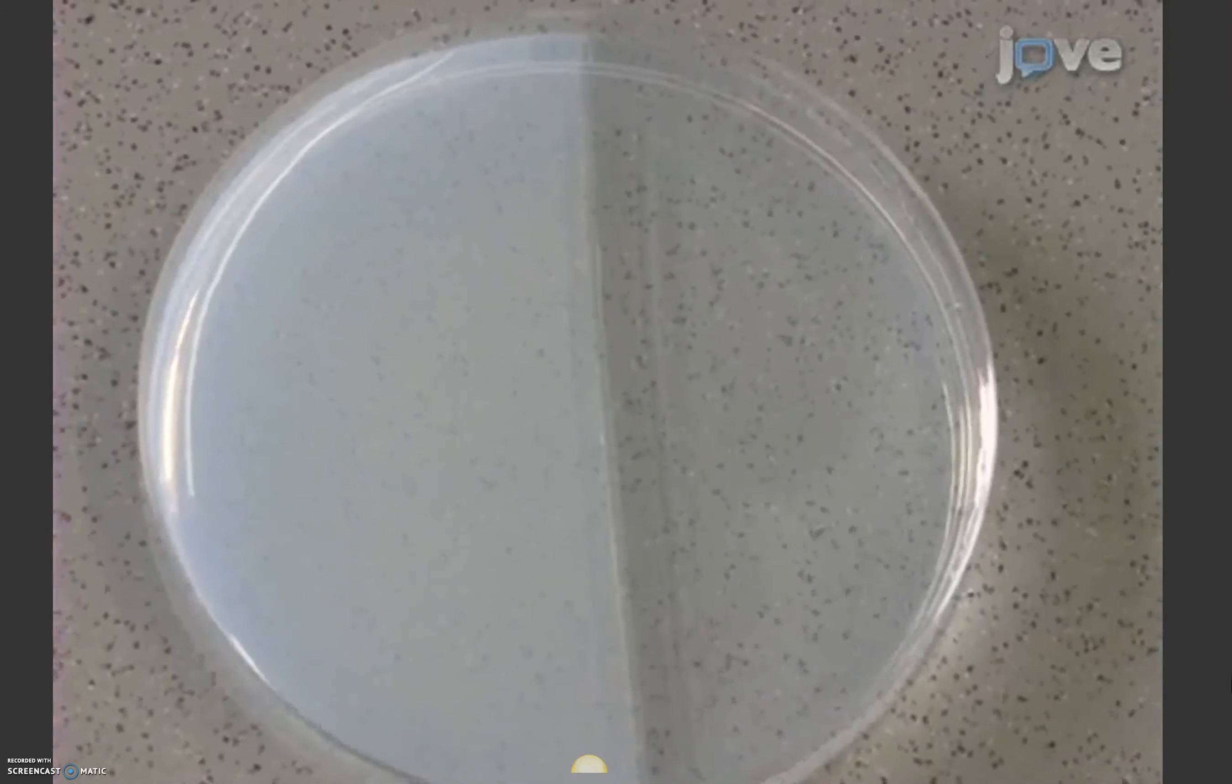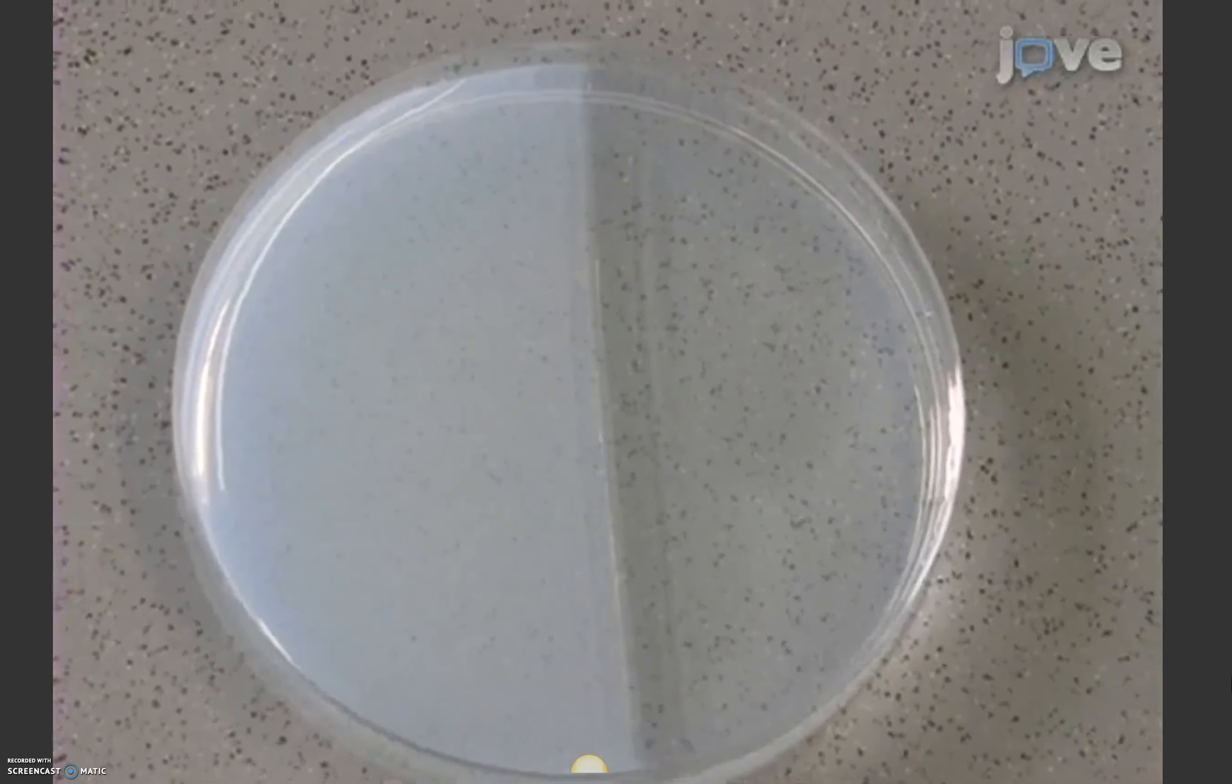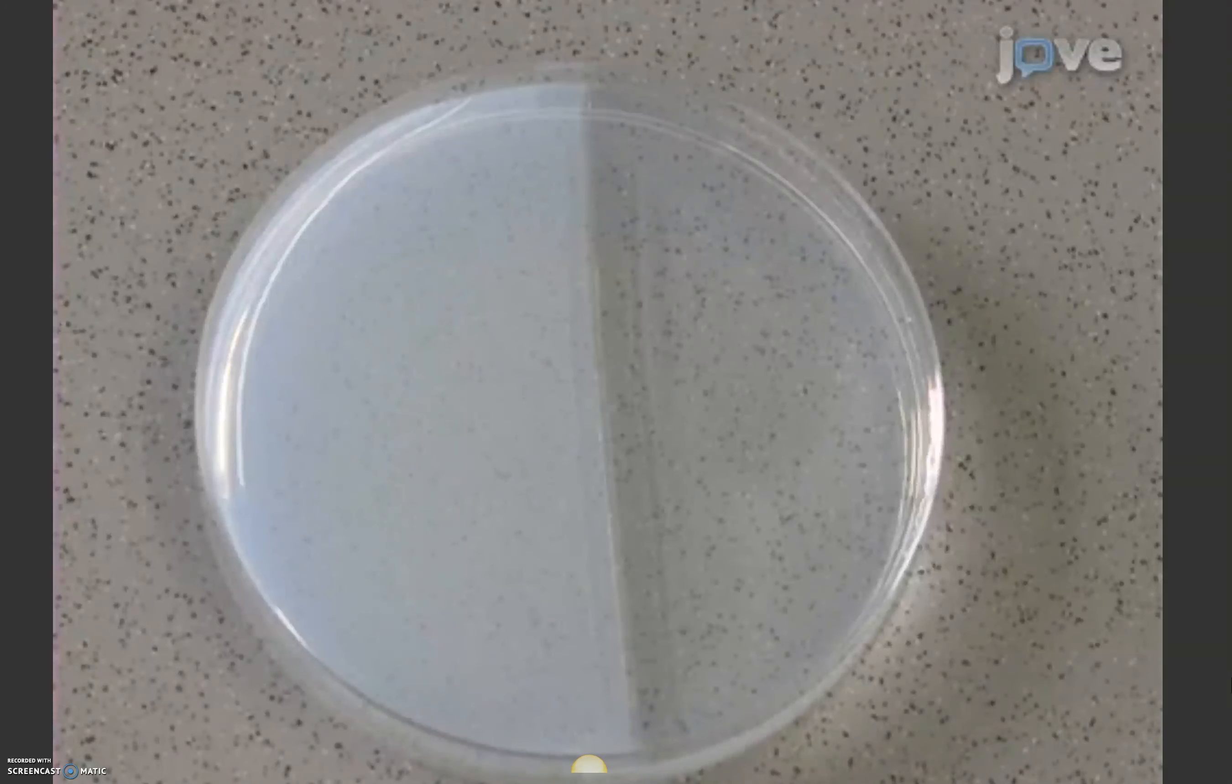Be careful that both halves match in volume and do not form a defined edge. This may require practice.